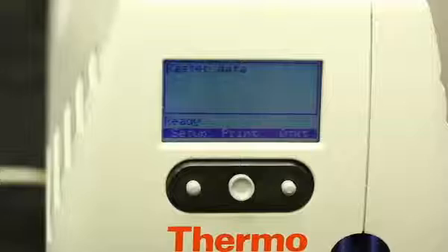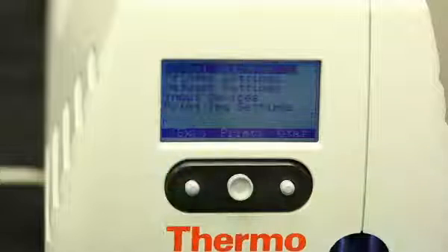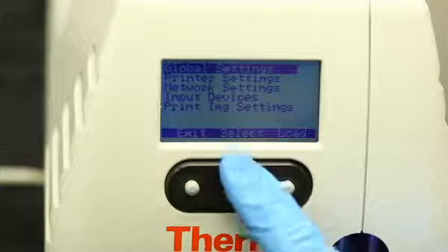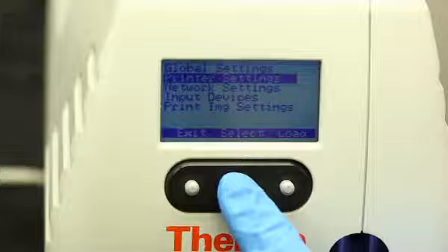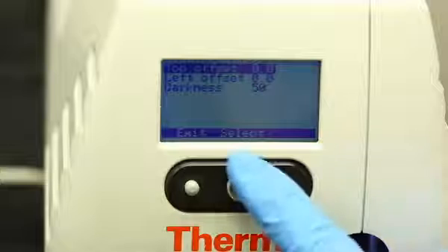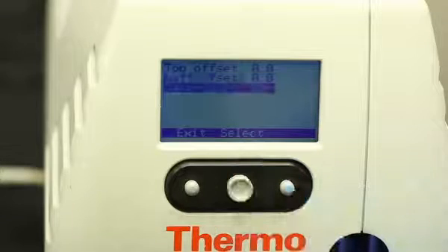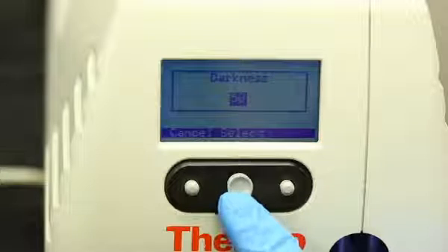Adjusting the darkness will sometimes fix poor printing. To adjust the darkness, press the Setup button on the front of the SlideMate. This will bring up a menu. Choose Print Settings and then choose Darkness. The default setting is 50. You can change the setting higher to adjust the print darkness.